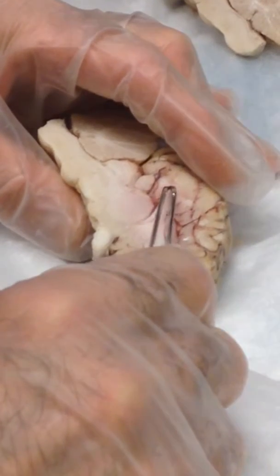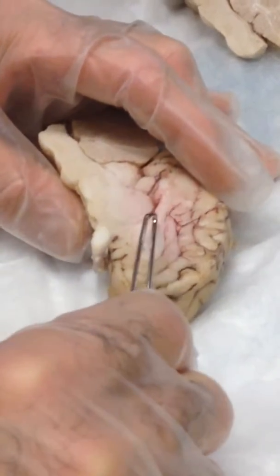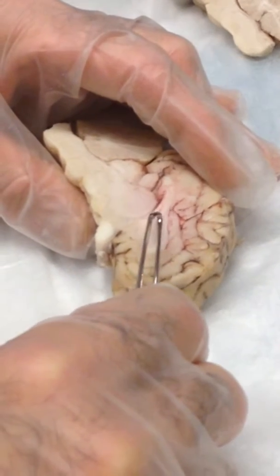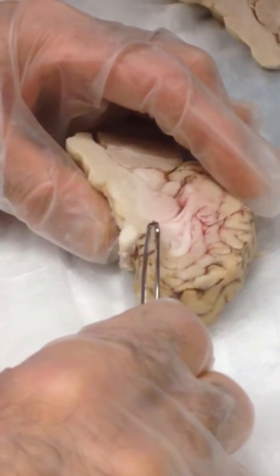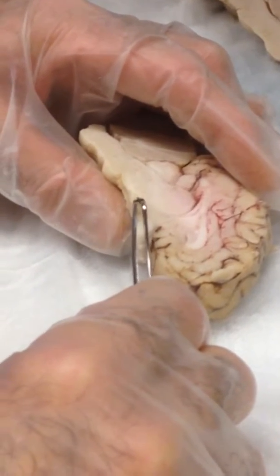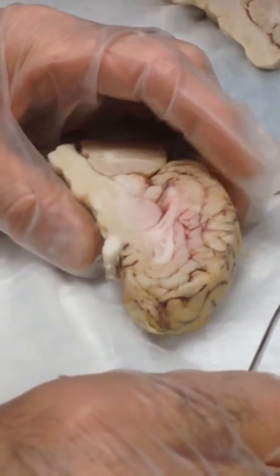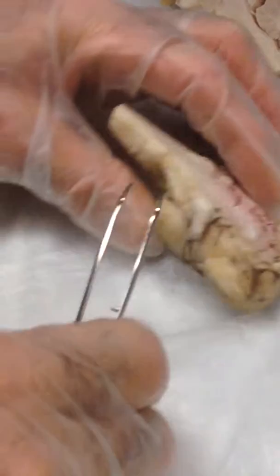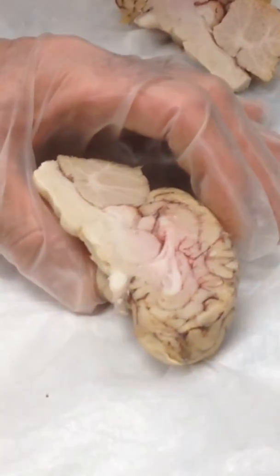This is the fibers of the corpus callosum, connecting the hemispheres. These fibers are the fibers coming from the hippocampus. It's called the fornix. That fornix will come around like this, turn at the anterior commissure, and continue to the mammillary bodies. There's the mammillary bodies. You see that? And so whenever in doubt, roll it. That's what it looks like on the midline cut.